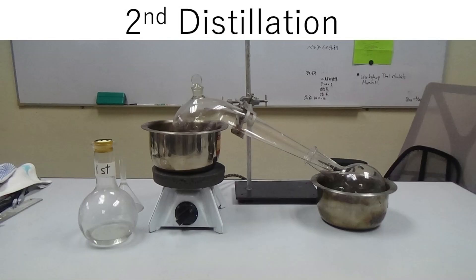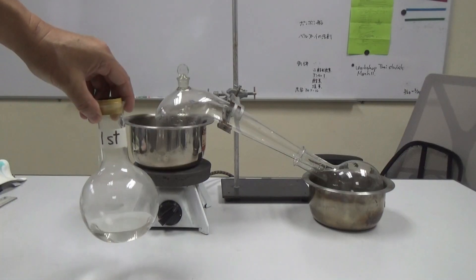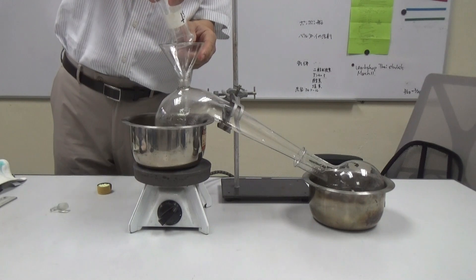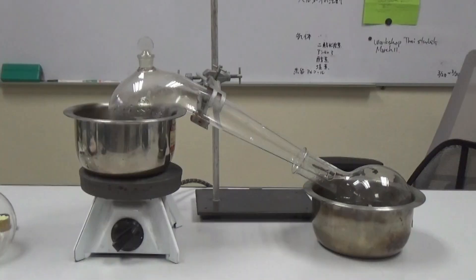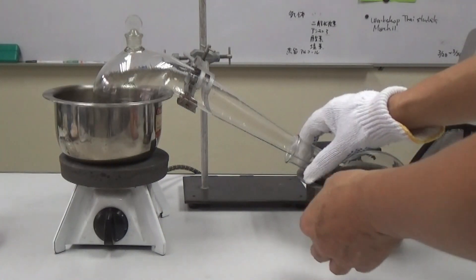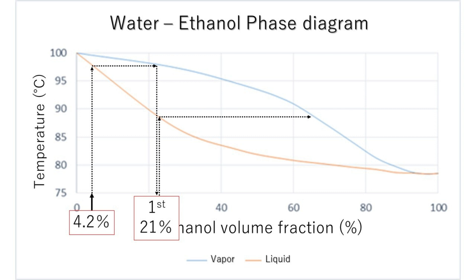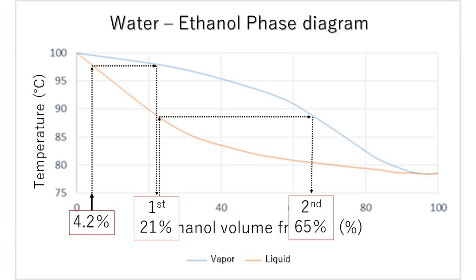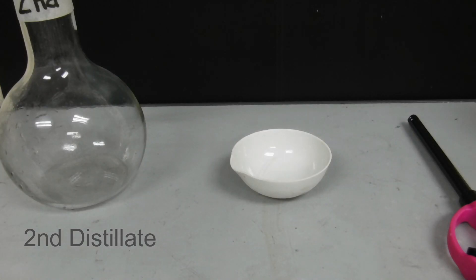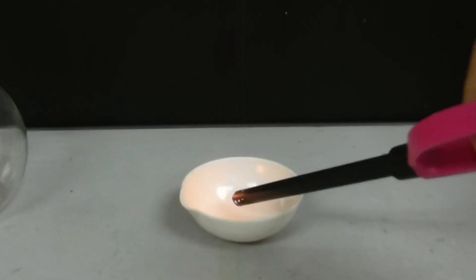Let's do the second distillation using the first distilled solution. The solution of 20% ethanol is distilled into approximately 60% ethanol solution. Let's ignite the second distilled solution again. Since the concentration was over 40%, it caught fire.